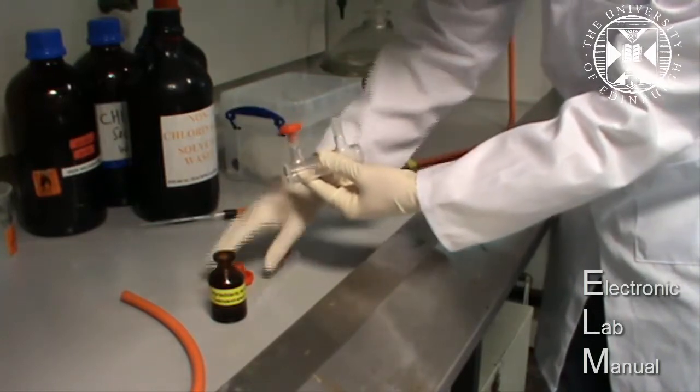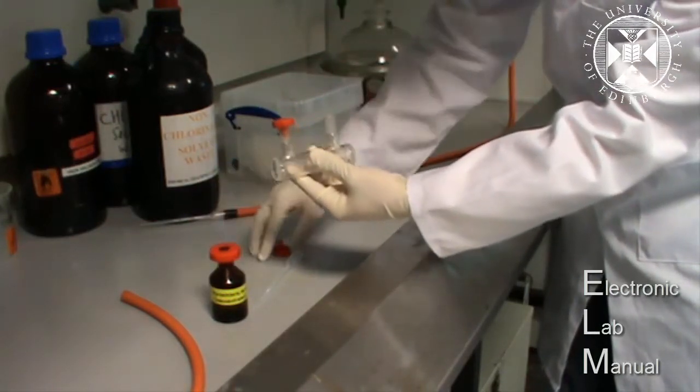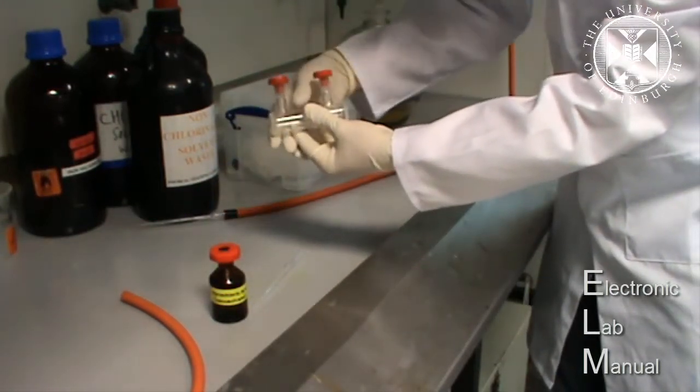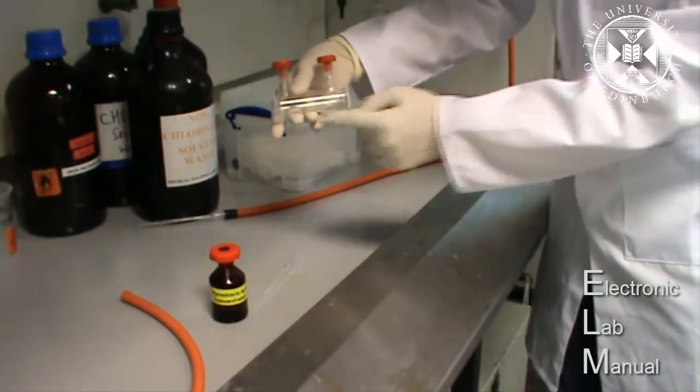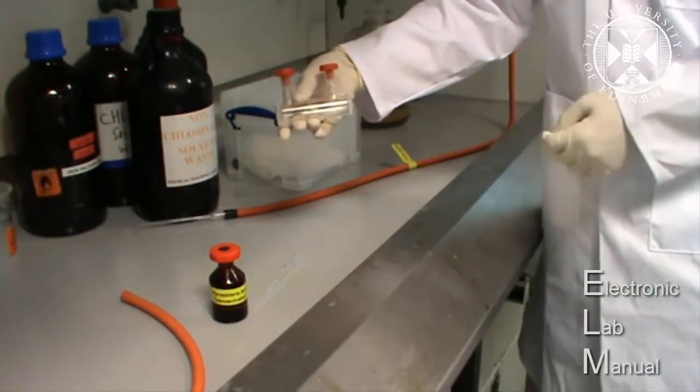Make sure also that when you've put the acid in the cell, the acid doesn't touch the windows at either end, because again that can affect the results.